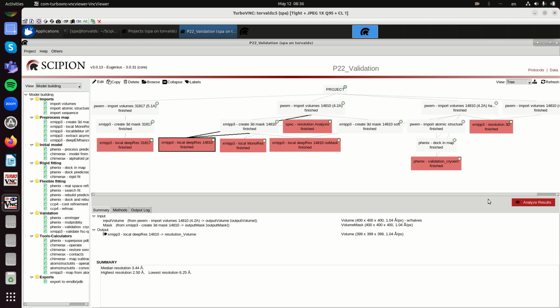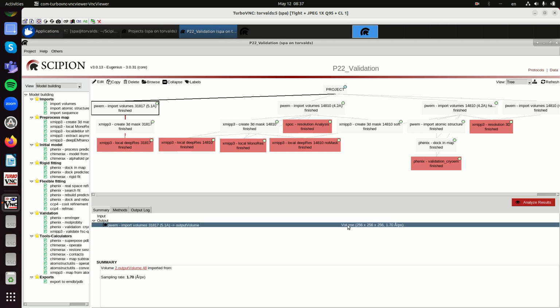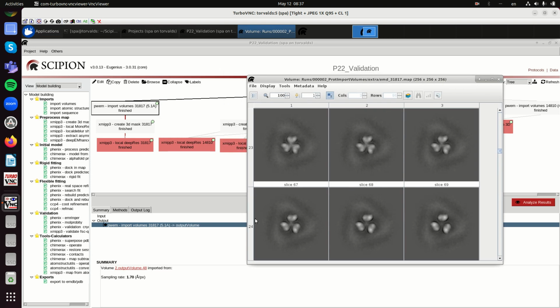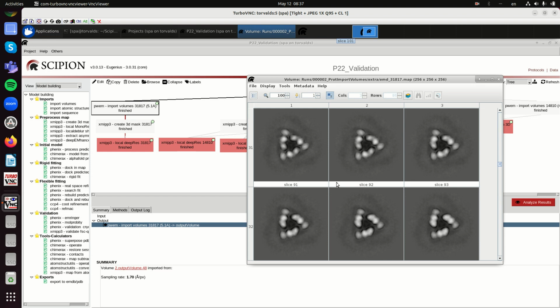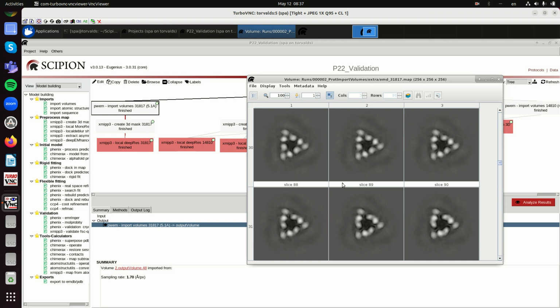But this number shouldn't be taken blindly. So let us see a few problematic examples. I have taken this map from EMDB, this is 31817. So let's look at the map. The resolution deposited or declared at the databases is 5.1 angstrom. But if you look at the structure, I think it is negative staining, so it doesn't have 5.1 angstrom, even if the claimed resolution is that one.